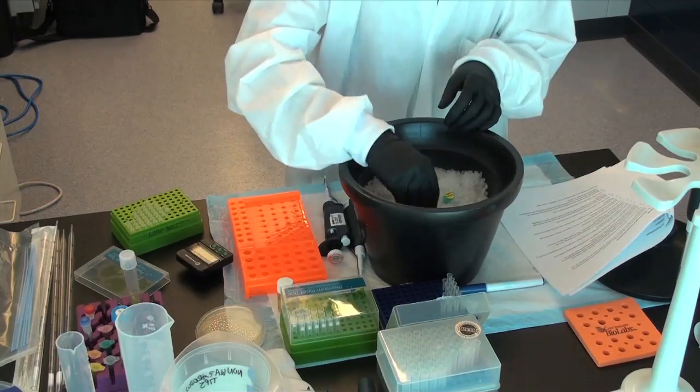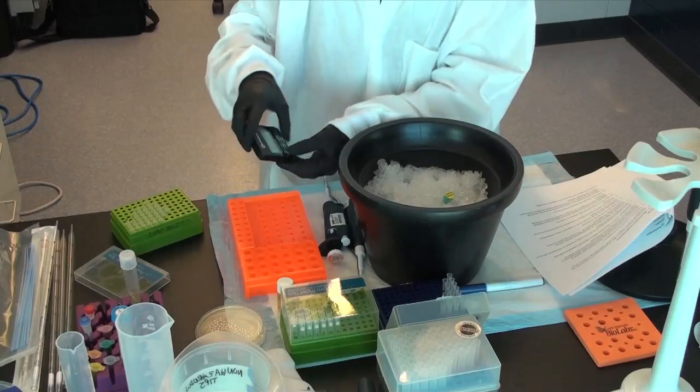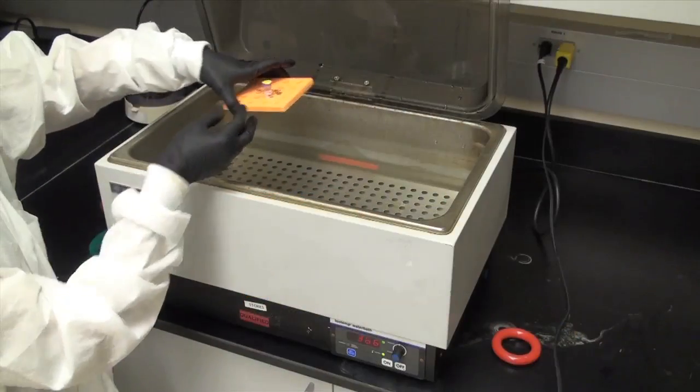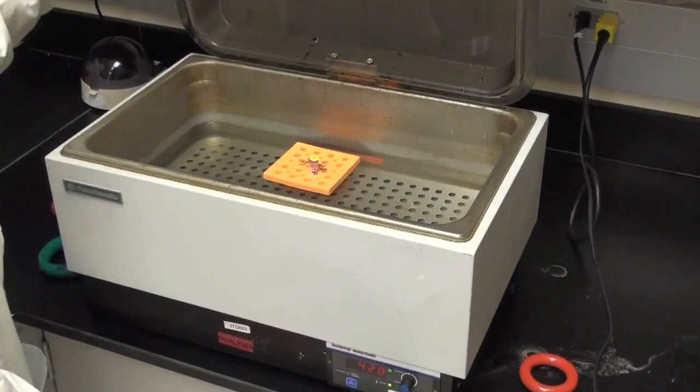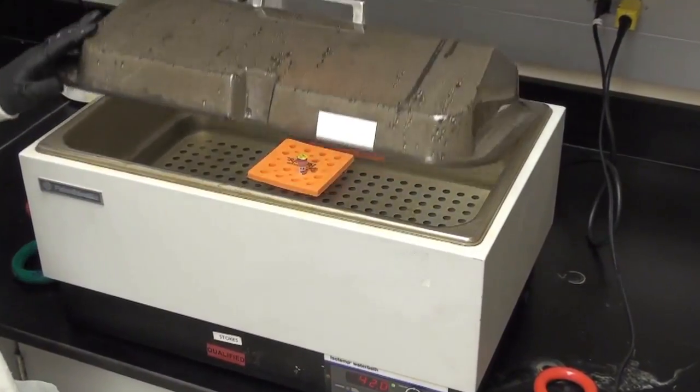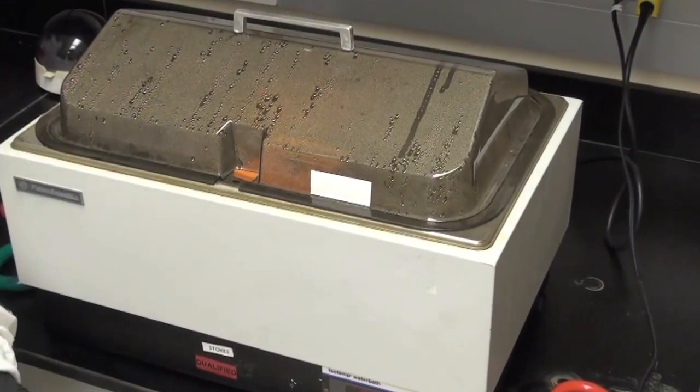Step 7: Incubate the vial on ice for 15 minutes. Step 8: Incubate the vial for 30 to 45 seconds in the 42 degrees Celsius water bath or heating block. Do not mix or shake.